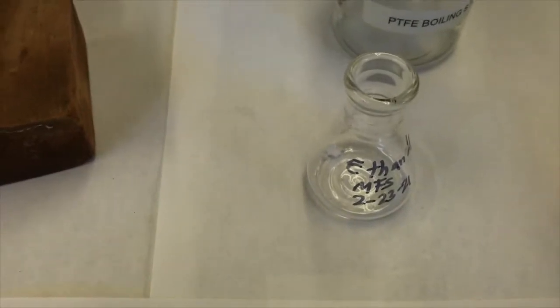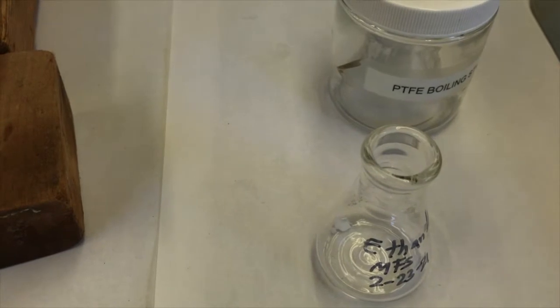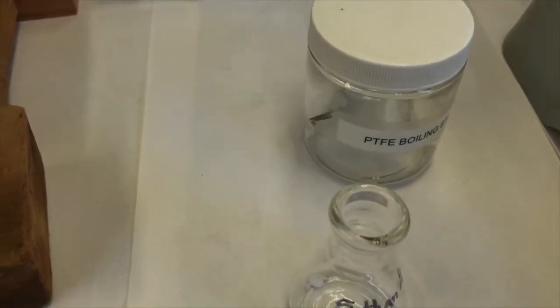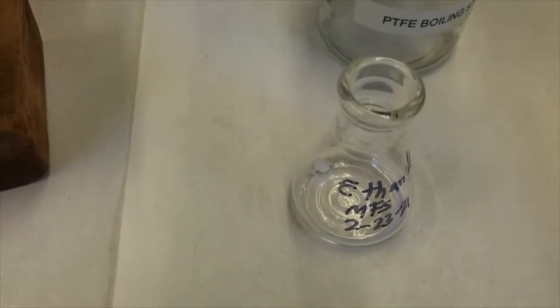So these boiling stones, or another term for them is boil easers, they ease the boiling. What they do is they allow the solvent to form little tiny bubbles on the surface of those boiling stones, you'll see shortly. And then it's releasing little tiny bubbles, which is much safer than if without that you might get a big bubble that bursts and splashes out of the container.